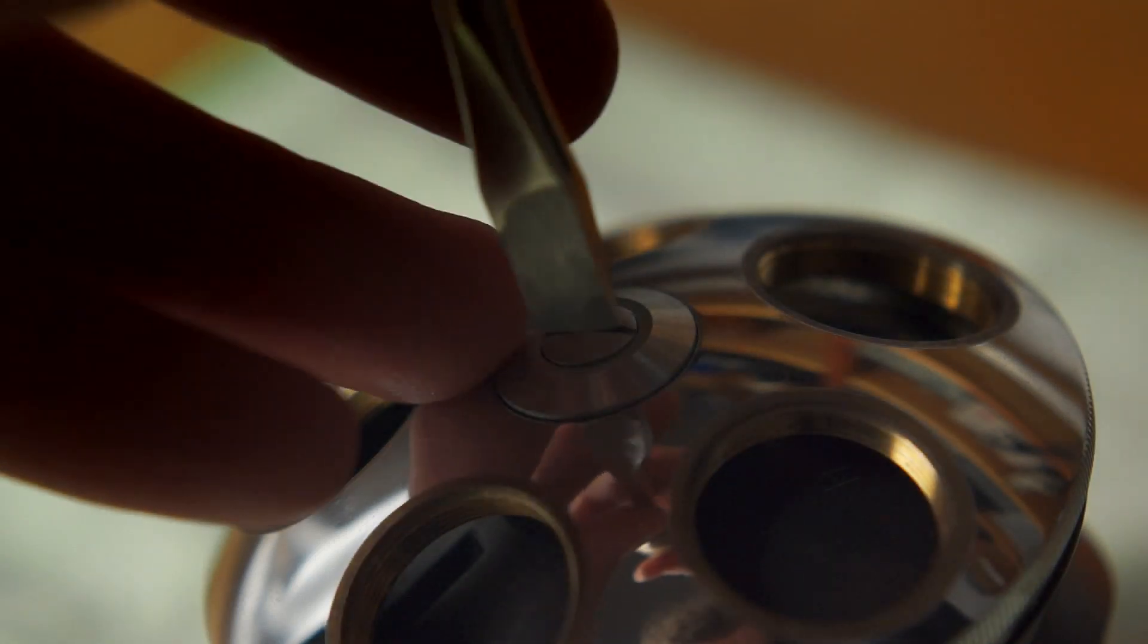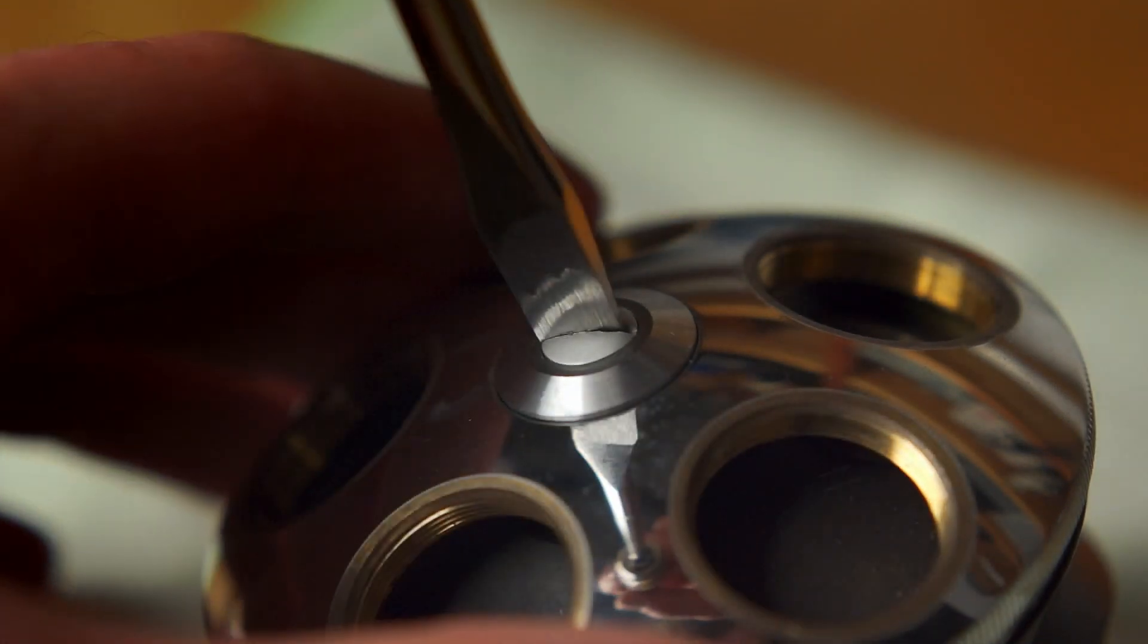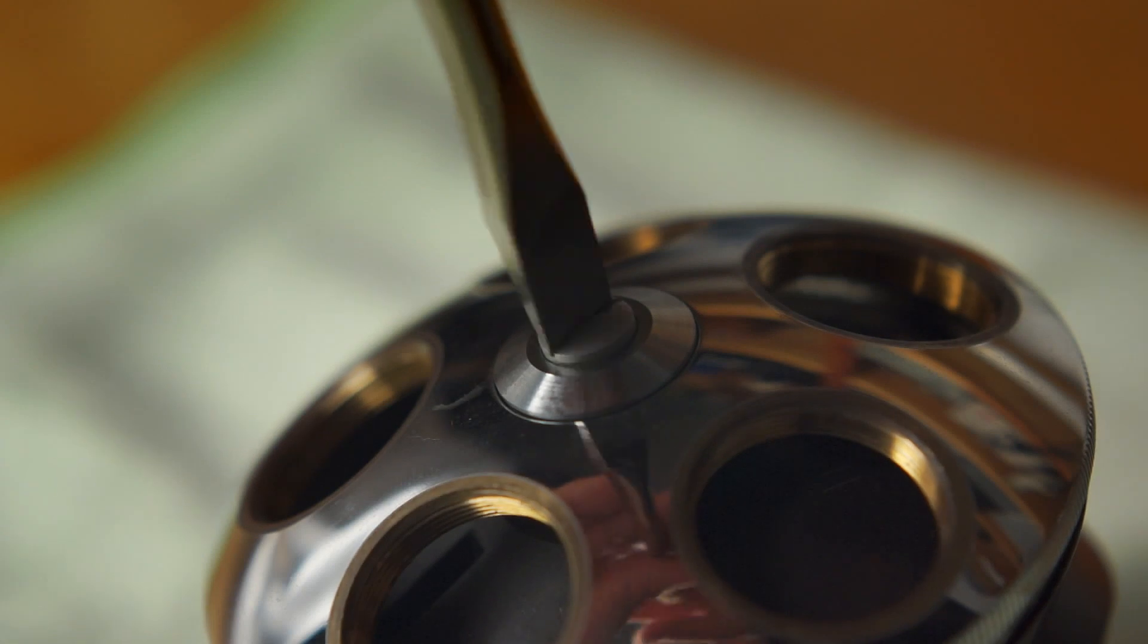Using the modified screwdriver, we now remove the retaining screw from the revolver and place it in a safe location.